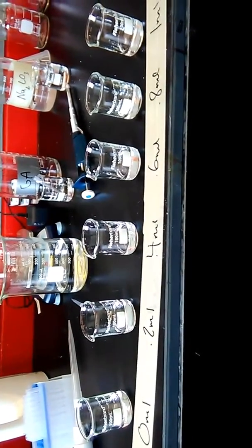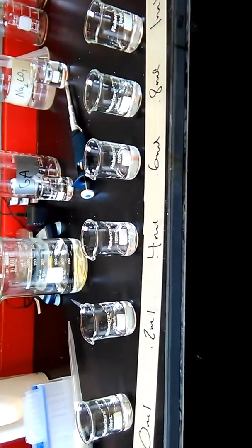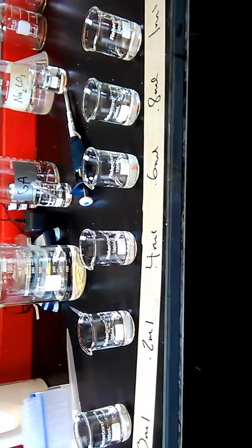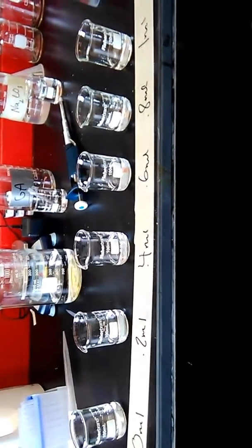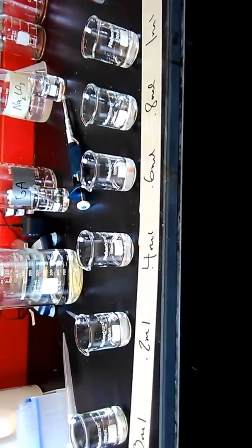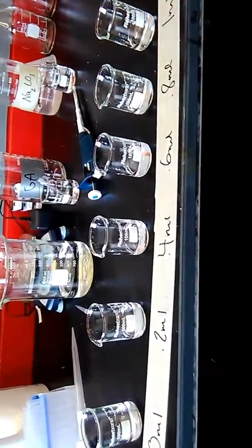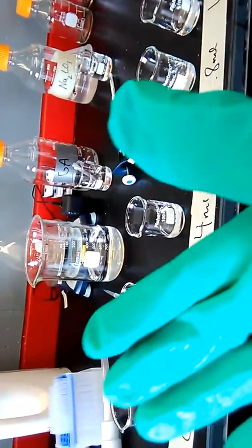So I've already done my distilled water, and I've also done my gallic acid. And the next thing we're going to do, and we need to do this quickly and carefully. As you can see, I have my gloves on.